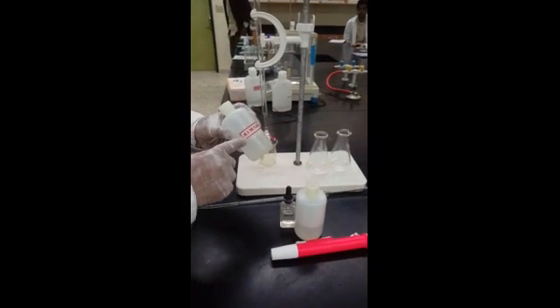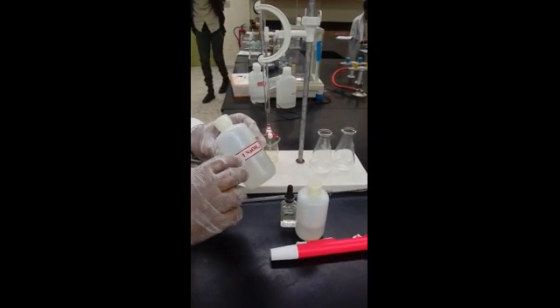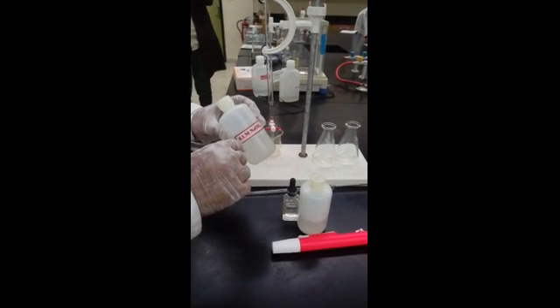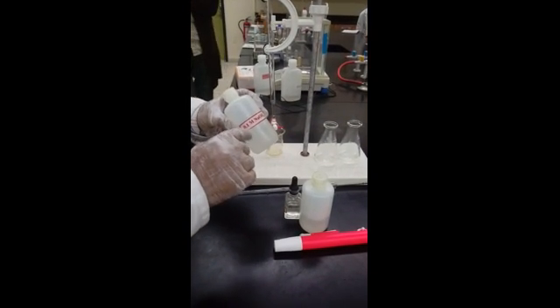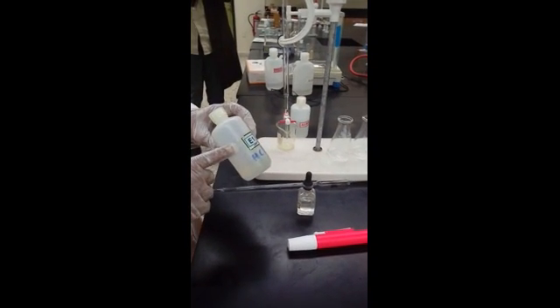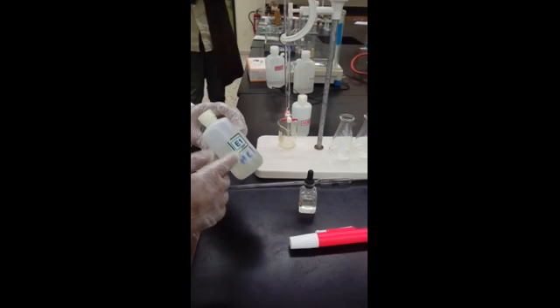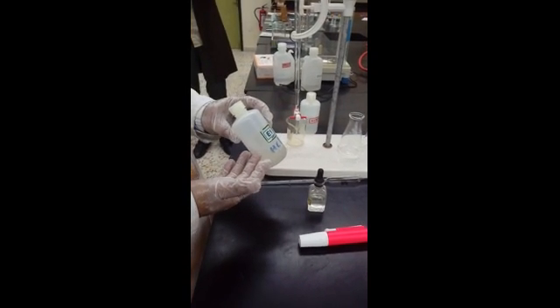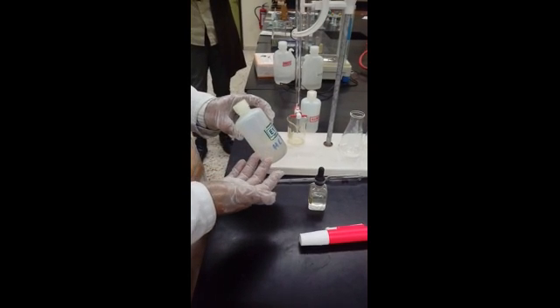This is 0.01 M sodium hydroxide standard base chemical. You know the molarity, 0.01 M, 0.1 M. And you will be given an acid. You don't know the molarity, so you have to find the molarity of this acid. So the objective is to find the molarity of the unknown acid.